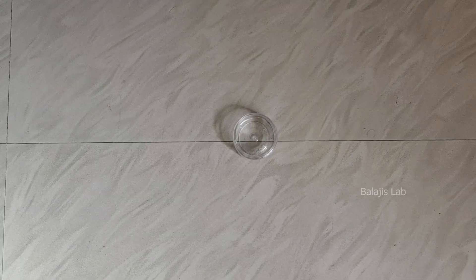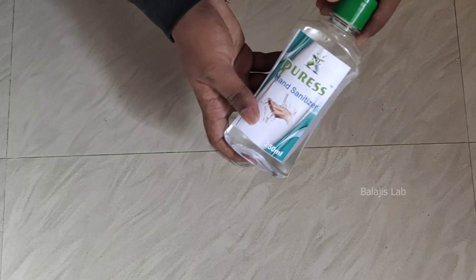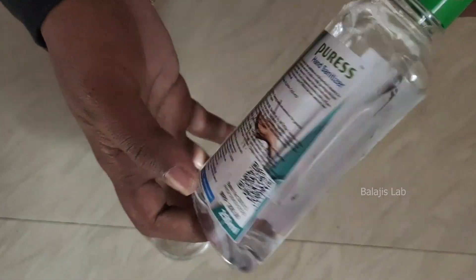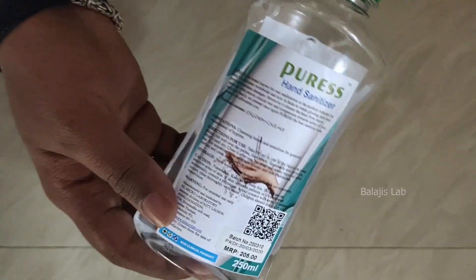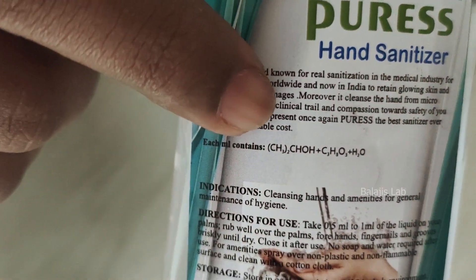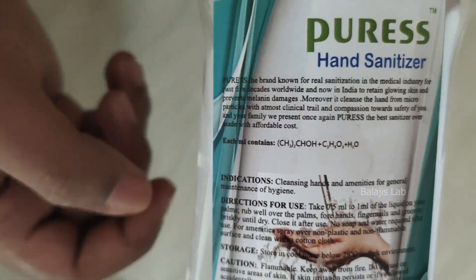How do you use it? Let's see how you use it. First of all, you will use hand sanitizer. I am using isopropyl alcohol based hand sanitizer. My next project is isopropyl alcohol.